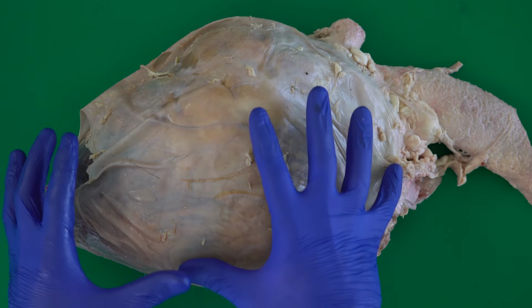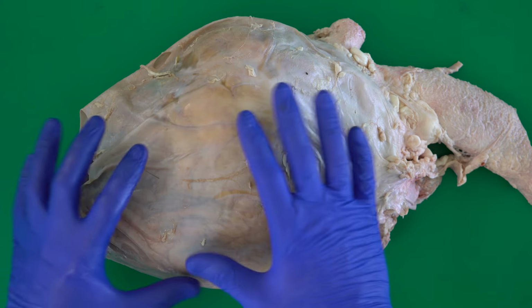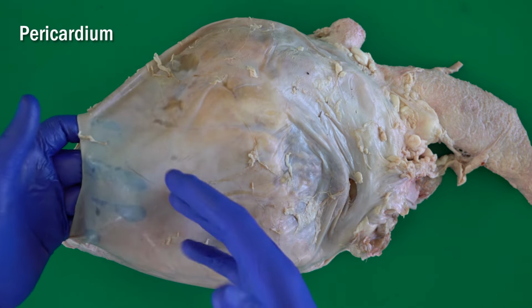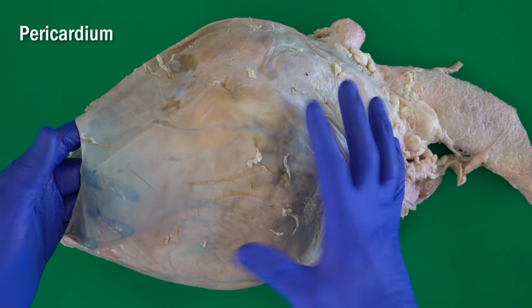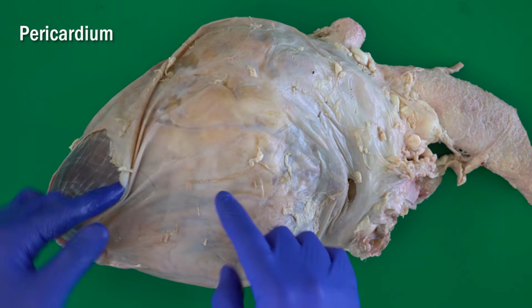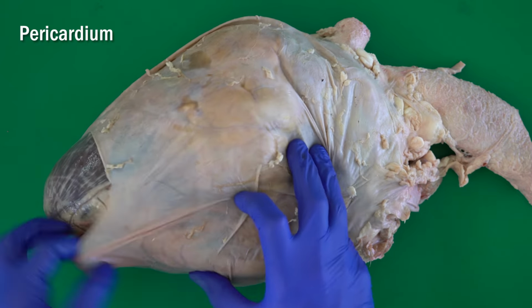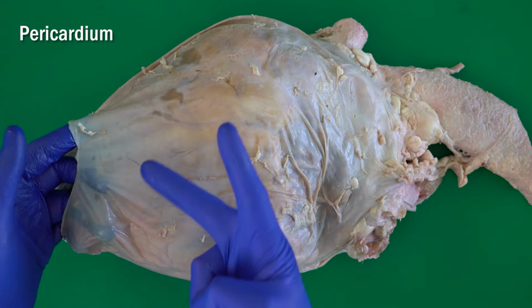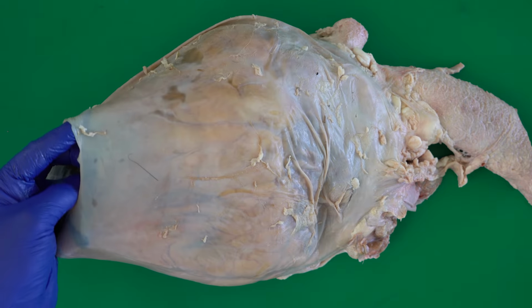Okay, here we can see the heart located inside this sac, the pericardium. So I am planning now to remove the pericardium completely. Before we do that, let me just remind you that this is the heart, located inside the pericardium. The pericardium itself has two layers.